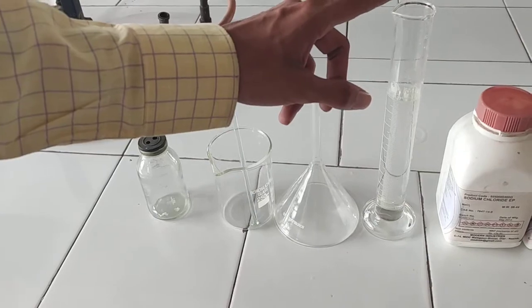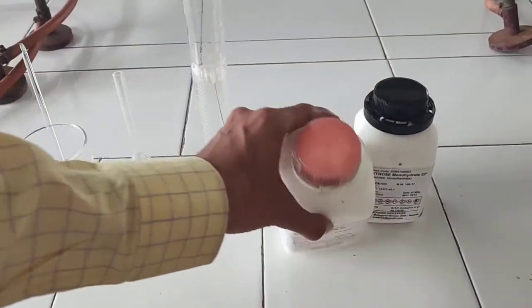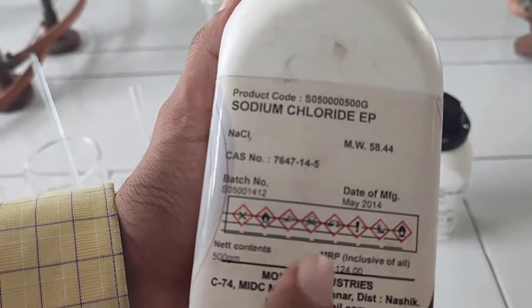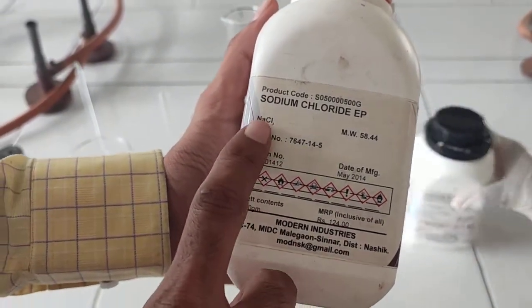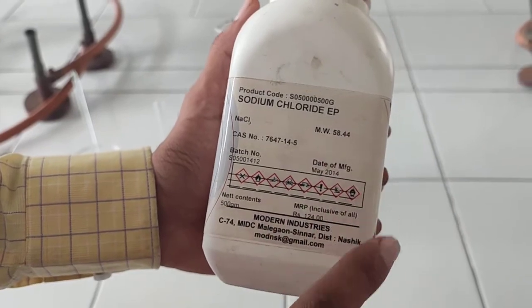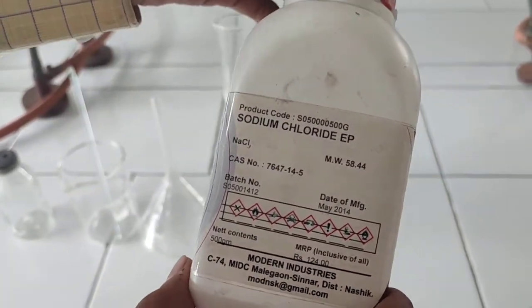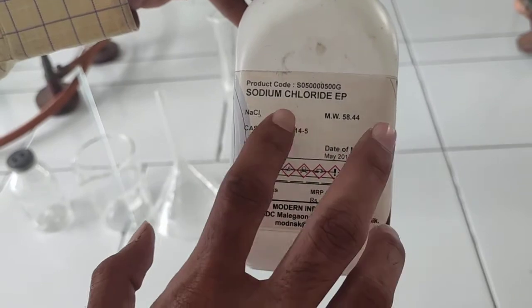We have a measuring cylinder for measuring 100 ml. Then we have sodium chloride solution — sodium chloride powder, which is NaCl, with molecular weight 58.44 — particularly prepared for lab scale. We use sodium chloride.